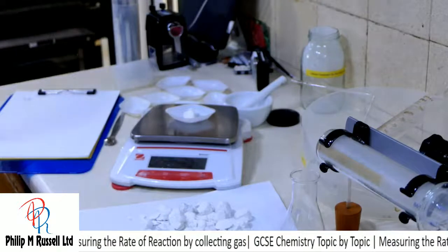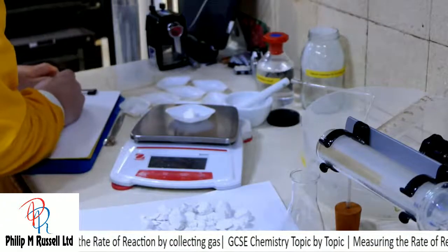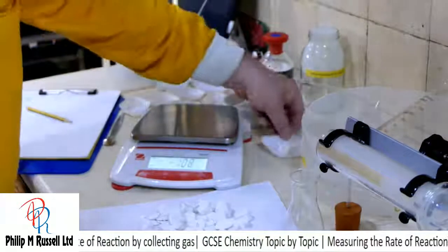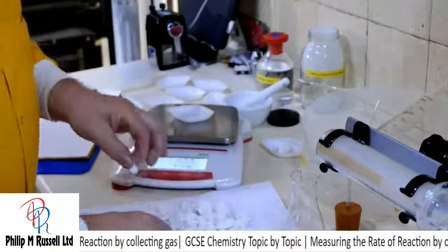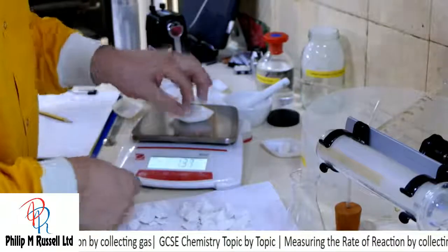And I've just been passed some hydrochloric acid. We're going to take some small pieces, and this is going to measure up to 4.8 grams again. So let's take some small pieces, and that's why I've poured all this out, so I've got some fairly small pieces.